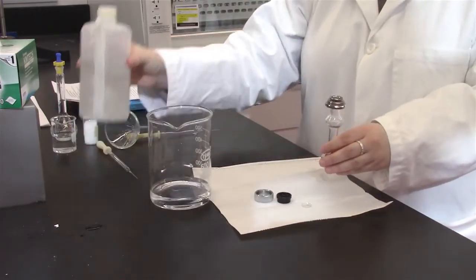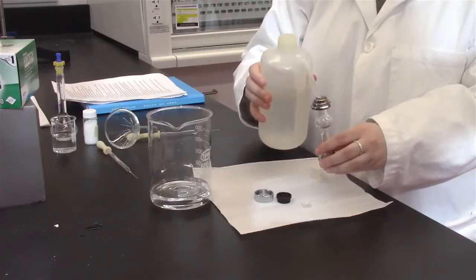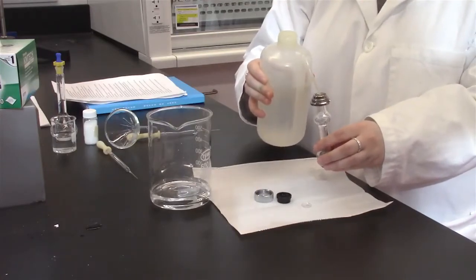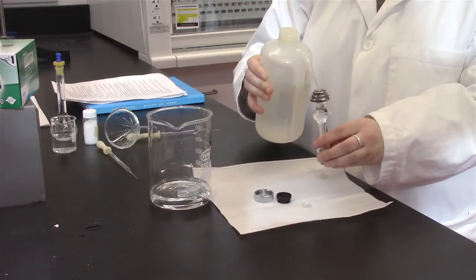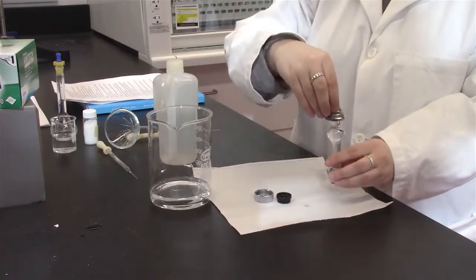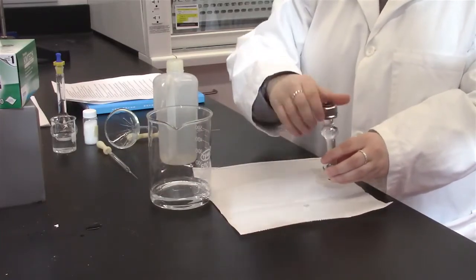Next, use deionized water to calibrate the machine. To do this, fill the sample holder to the top with deionized water and ensure no bubbles are present.